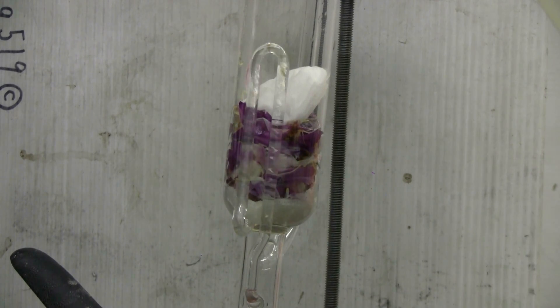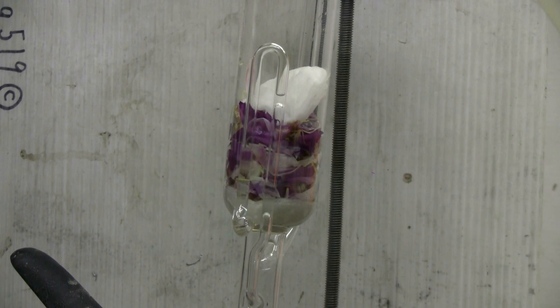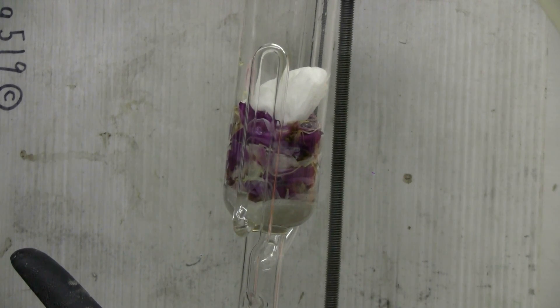At this point I'll have to switch over to recovering my ether out of the extraction mixture that's contained in the boiling flask. So I'll do that and pick up the video.